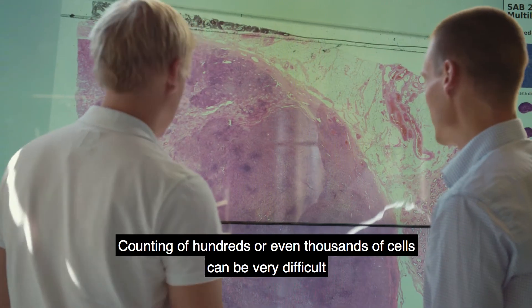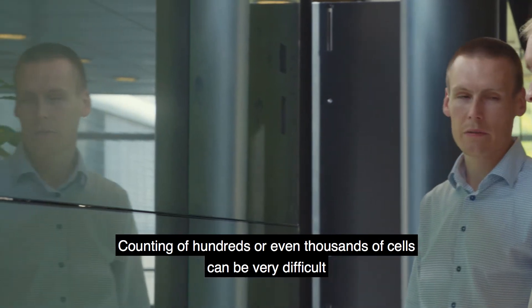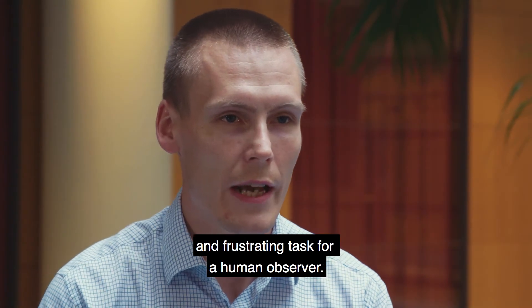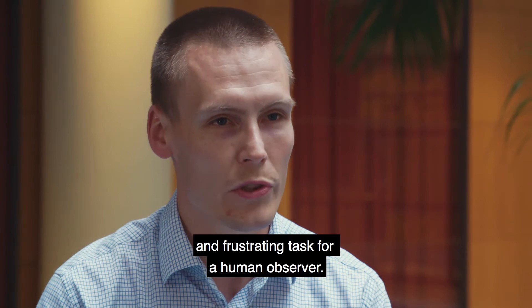Counting hundreds or even thousands of cells can be a very difficult and even frustrating task for a human observer.